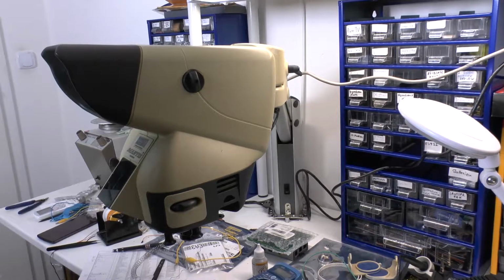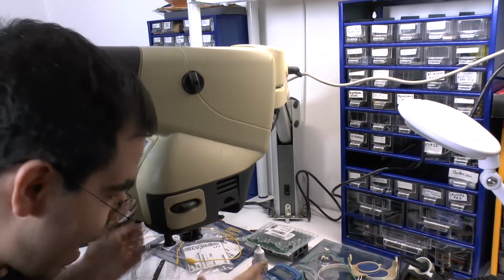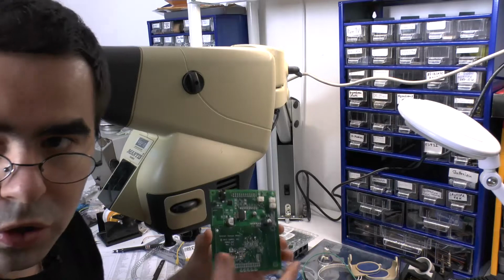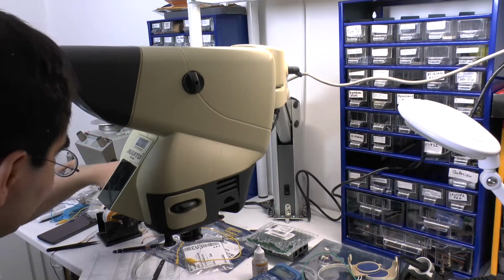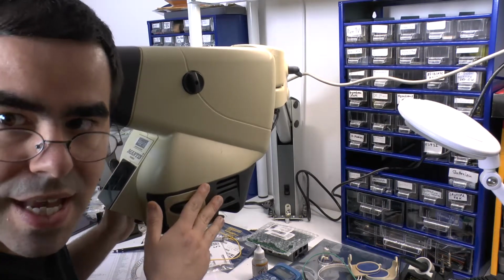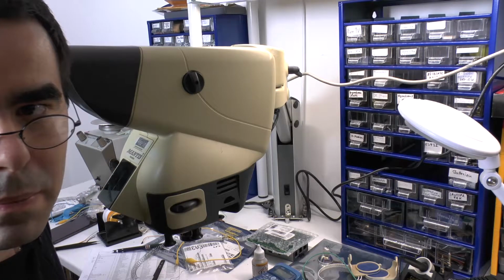Hello friends, it's the perfect storm. I was sitting here, it's 3 a.m. and my Mantis microscope just croaked while I was working on an already heavily delayed prototype for Raper. Either way, I decided, because it's not so often that somebody diddles around with such a Mantis, I'm gonna let you look over my hands a little bit and show you what I'm up to.